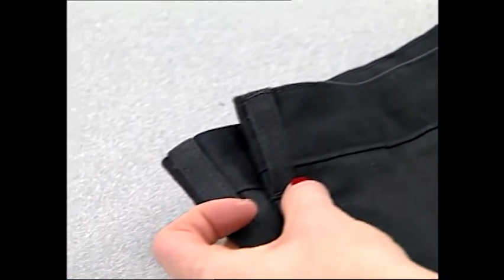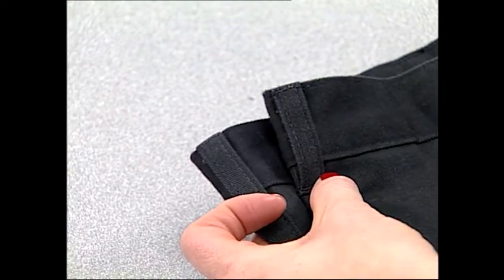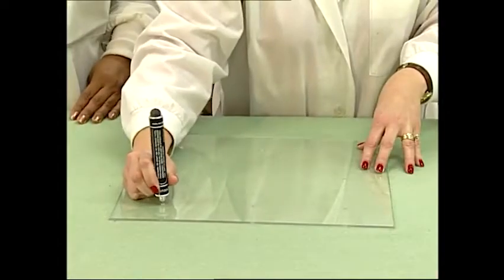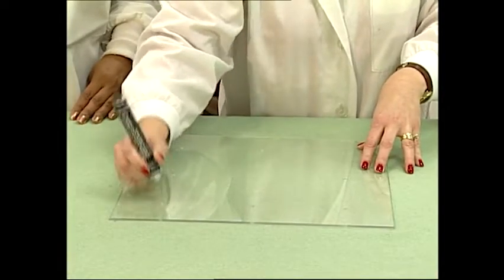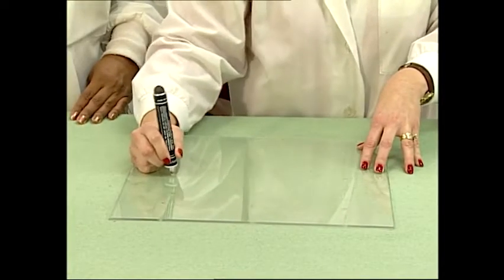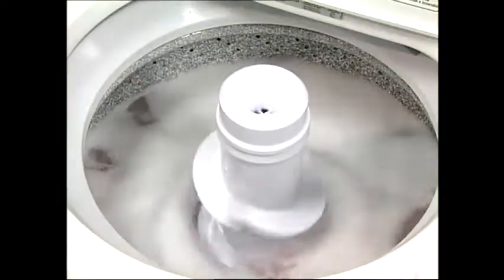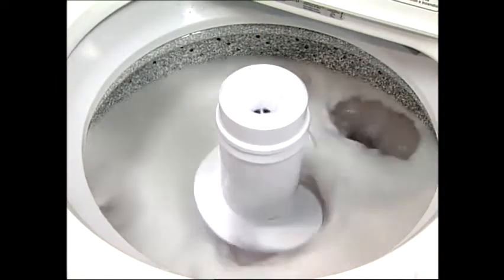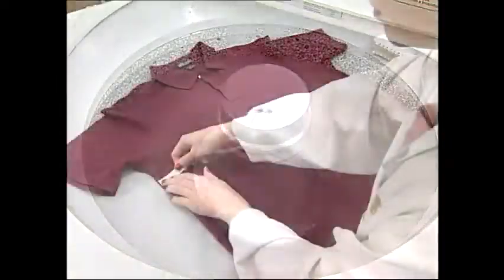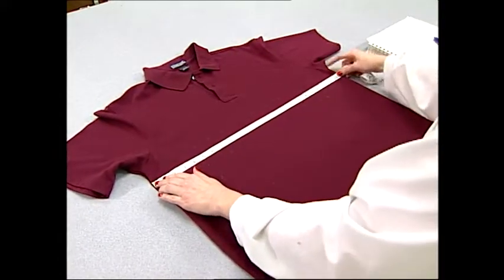There are many methods for measuring the shrinkage of cotton fabrics and garments. The most reliable methods use a system that properly prepares the sample for the test, will agitate the goods without tensions or restrictions during wet agitation, and accurately measure the results.